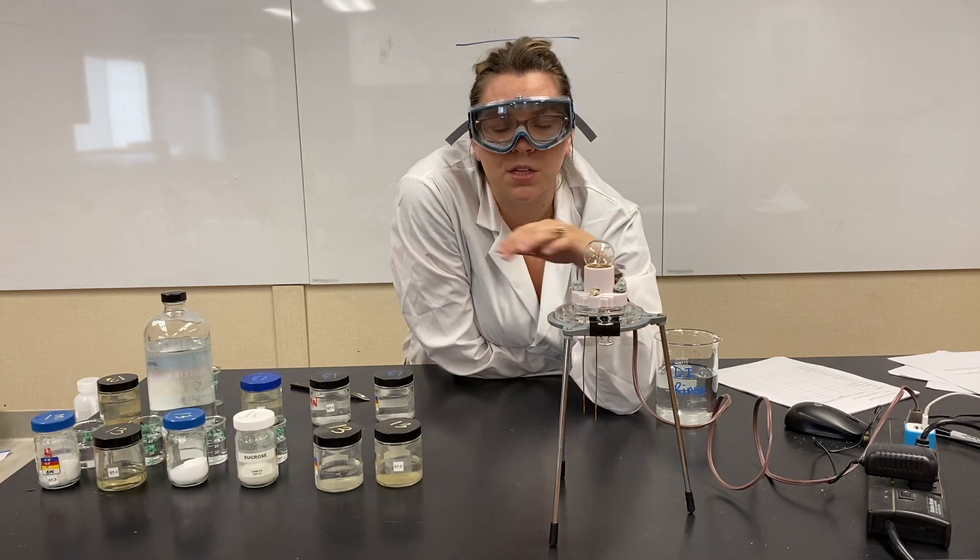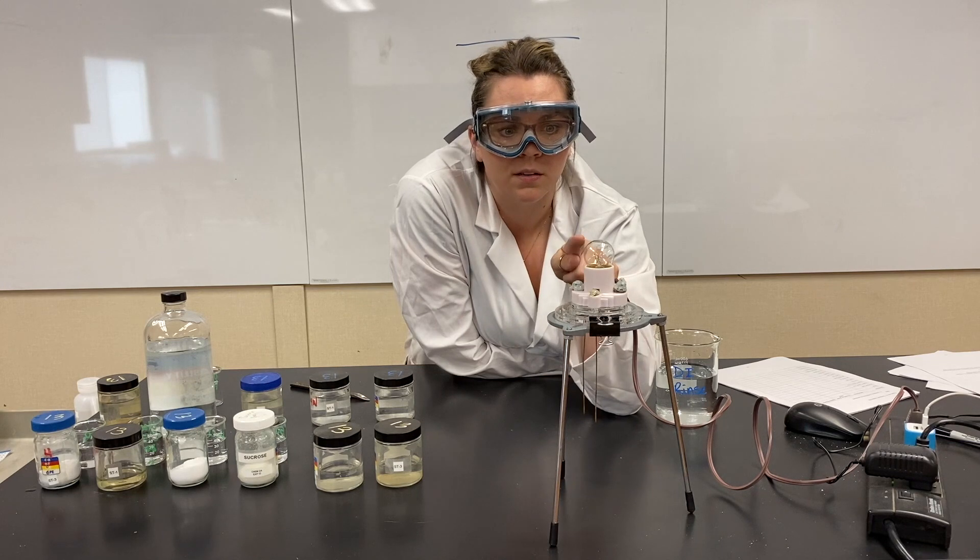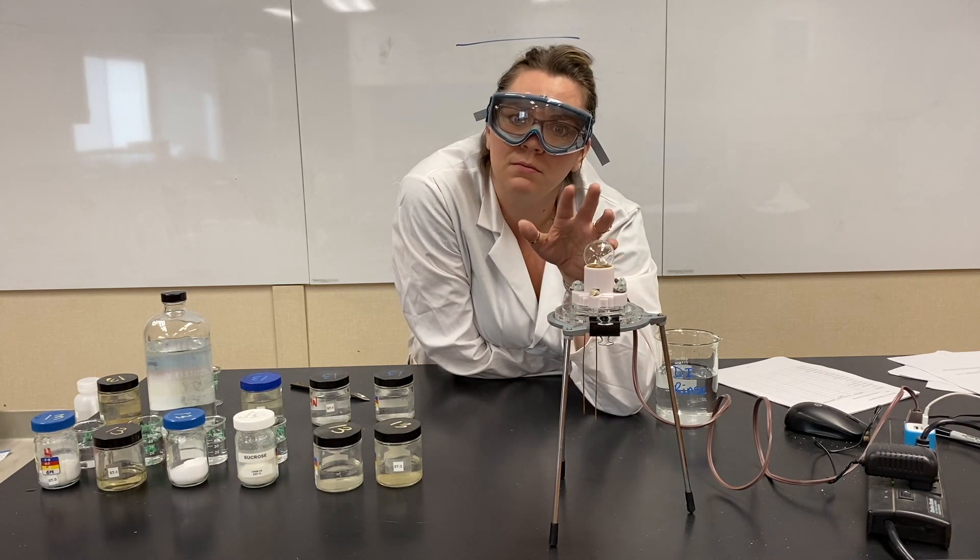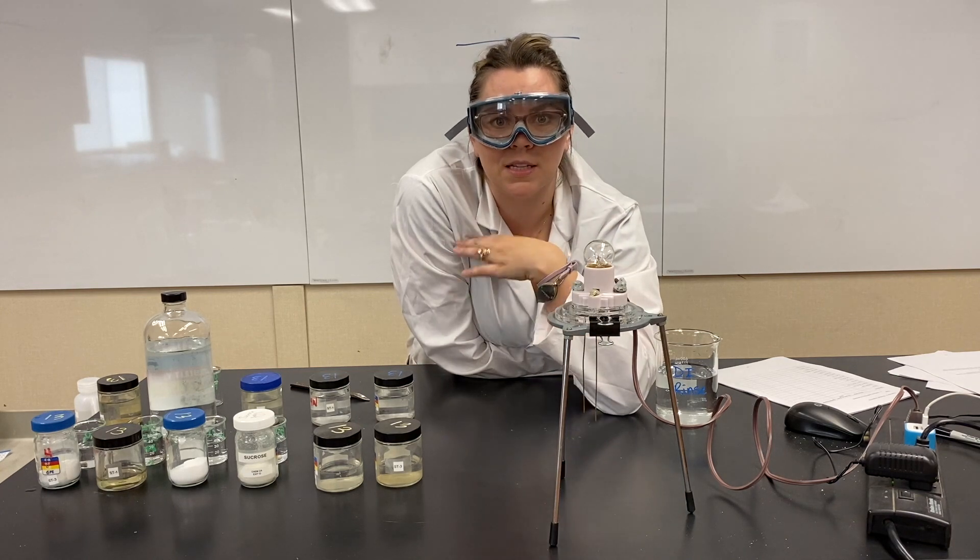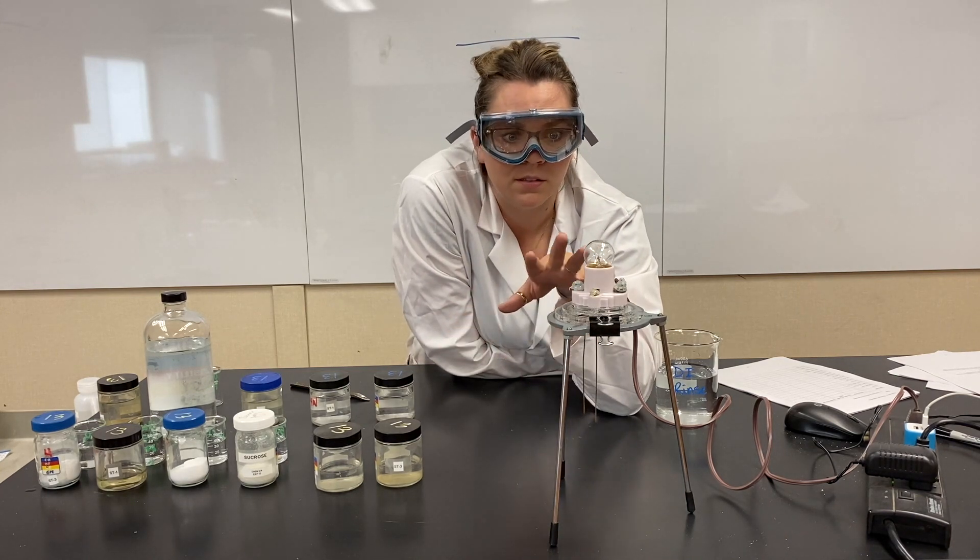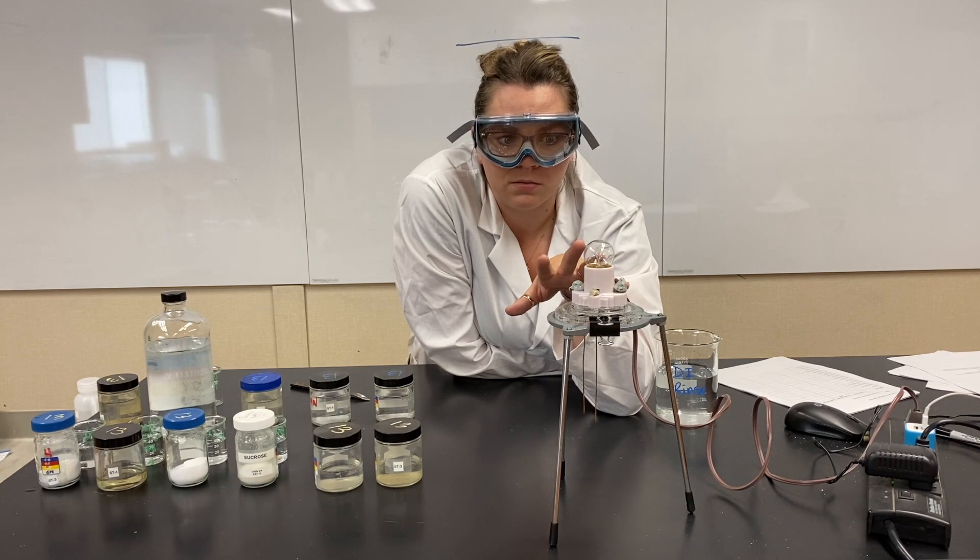If the solution is a weak electrolyte, the light will come on, but it'll be weak. It'll shine dimly. If the solution is a non-electrolyte, the lights are not going to come on at all.